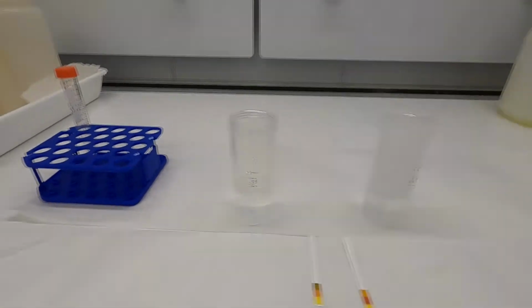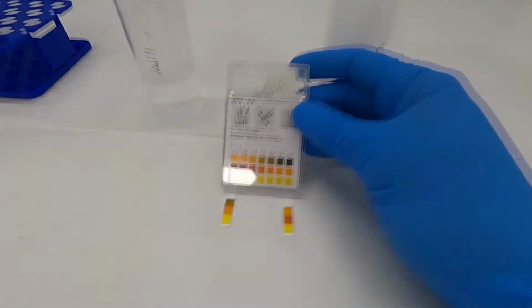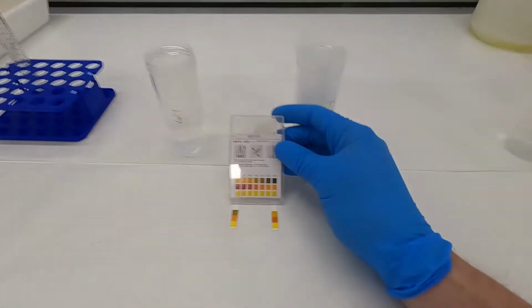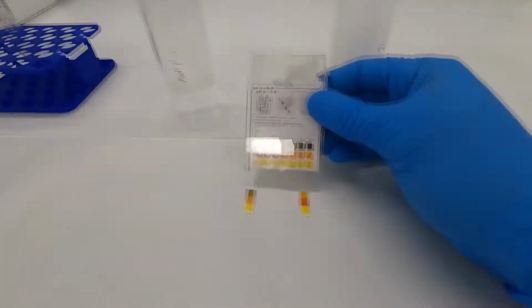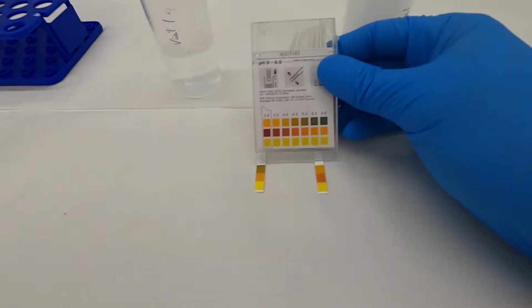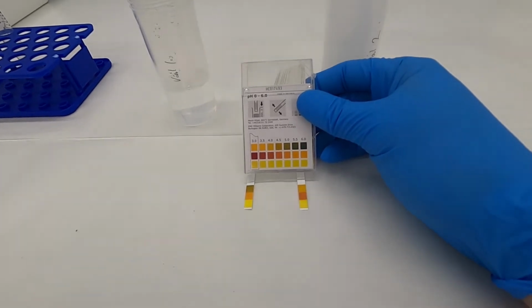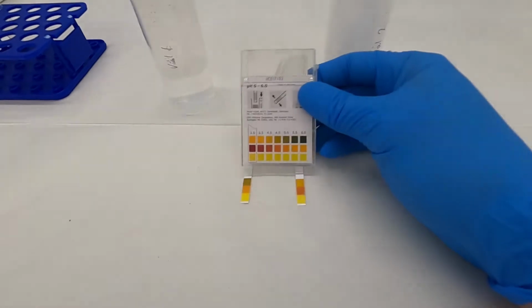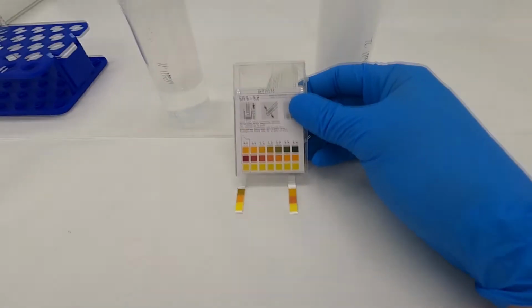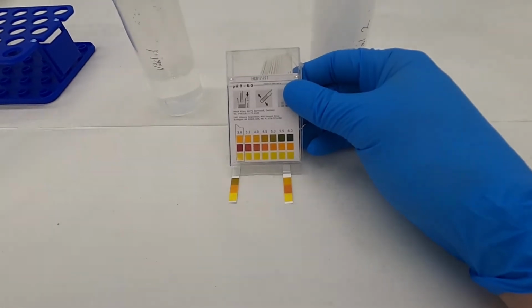Alright, let's have a look. So hopefully the colors are coming out okay here and that we're in focus. I'm actually going to position these. Okay, let's see. Let's do the one on the left. To me that looks like it's a pH of about 5. And the pH of vial 2, which has been bubbled with carbon dioxide, looks like it has a pH closer to 4.